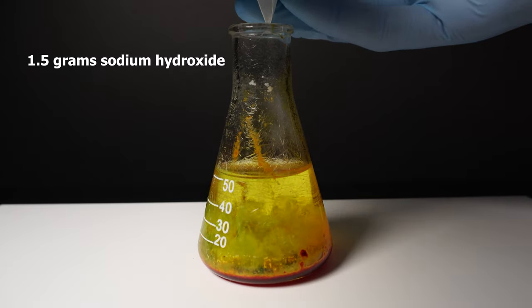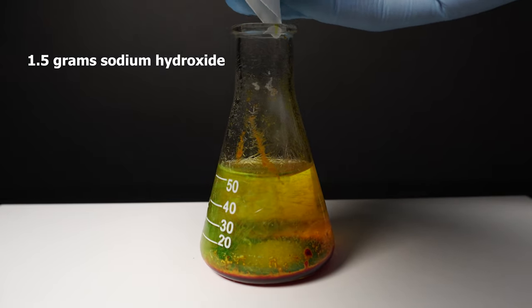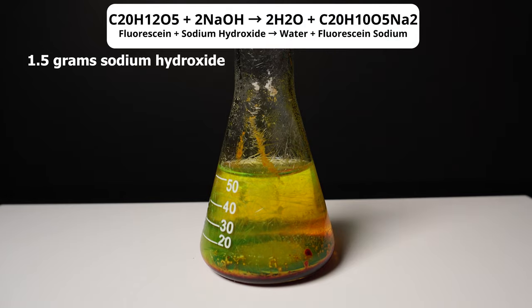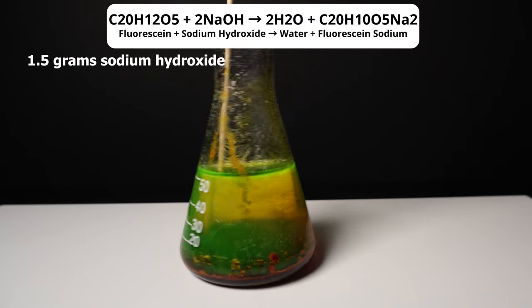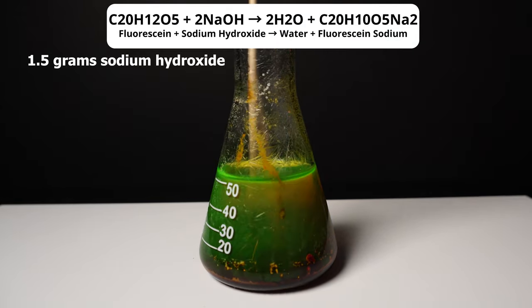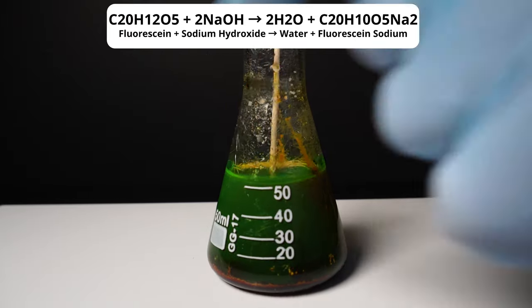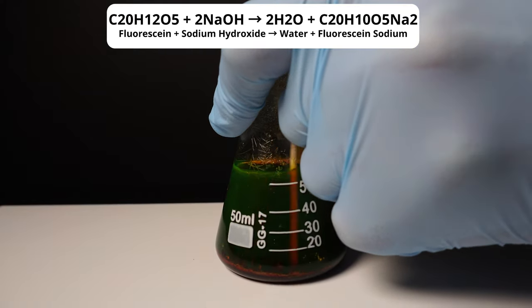Next we add in our sodium hydroxide, which I bought as drain cleaner. This will convert the fluorescein molecule into a salt known as sodium fluorescein through an acid-base reaction, and sodium fluorescein will be our final product.